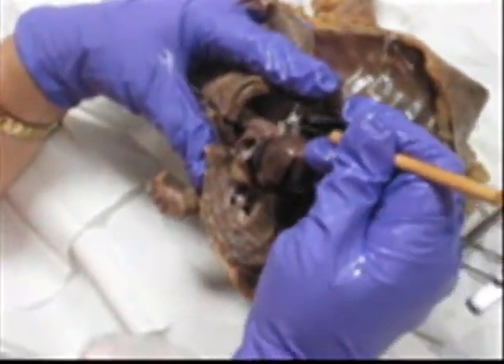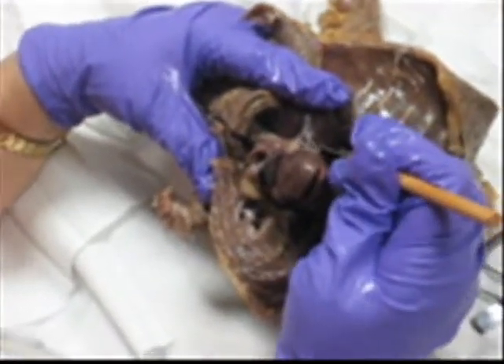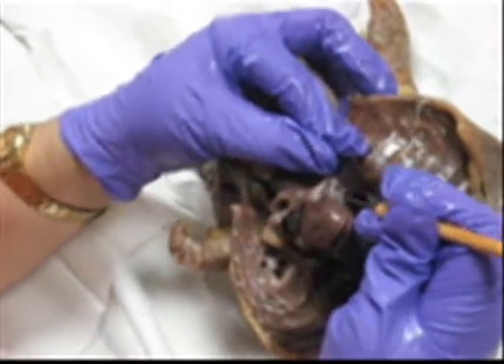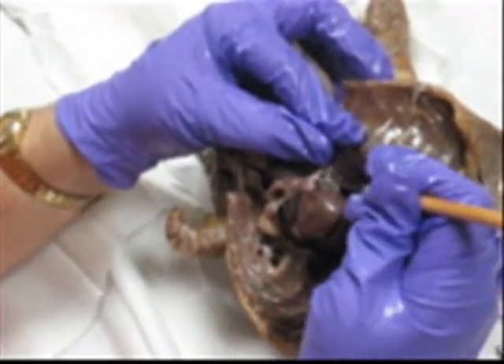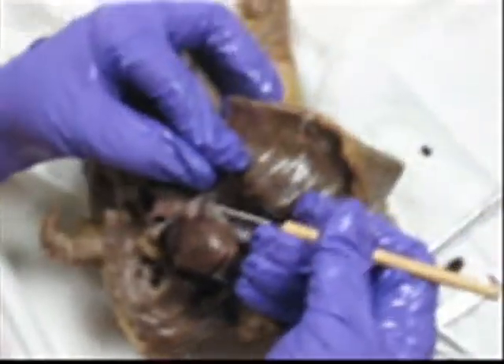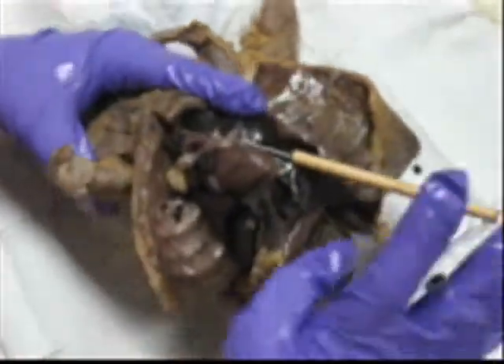It should be red, although in every mink I've seen so far it's blue or dark green. Next to it is a deeper, bluer one. If it's deeper, if it's smaller, if it's next to it — pulmonary artery.